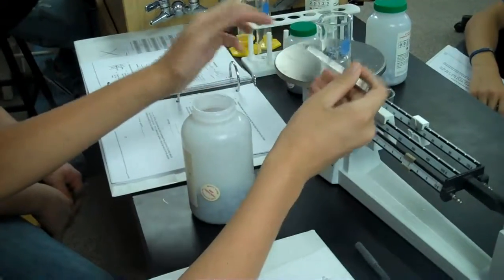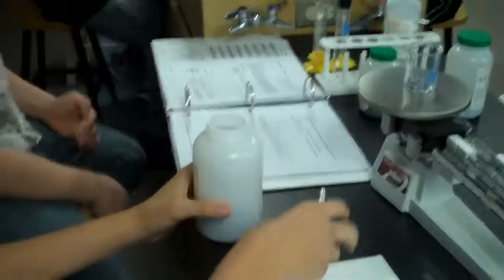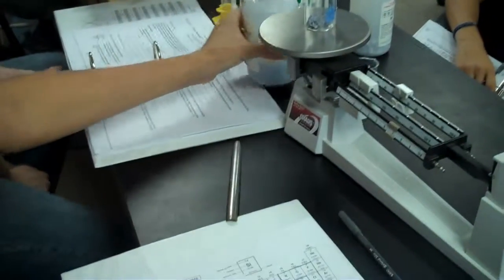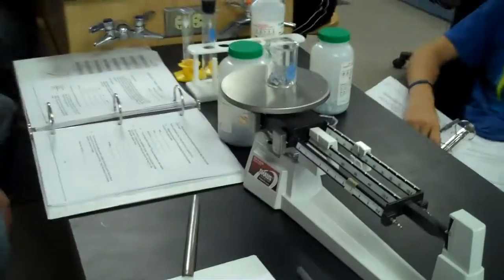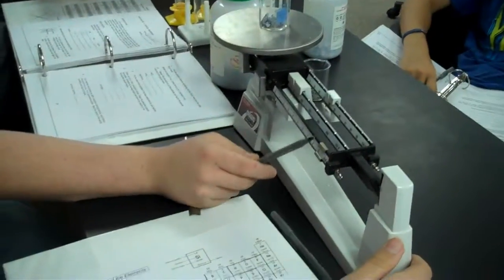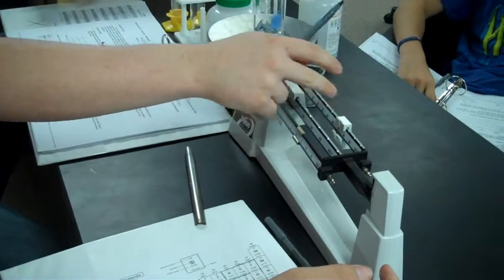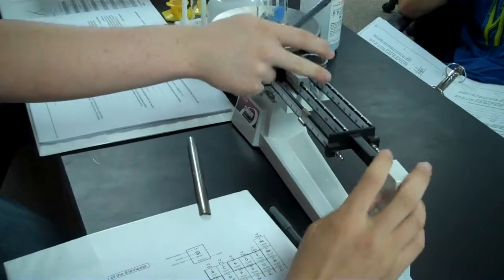Just go ahead and put it in there. Just don't touch what's left in the beaker or in the container. Okay. Does somebody else want to do the scale? Since DJ did the first one, somebody else can do the scale. You're gonna have to go that way. Other way. Yeah. This has to go up.